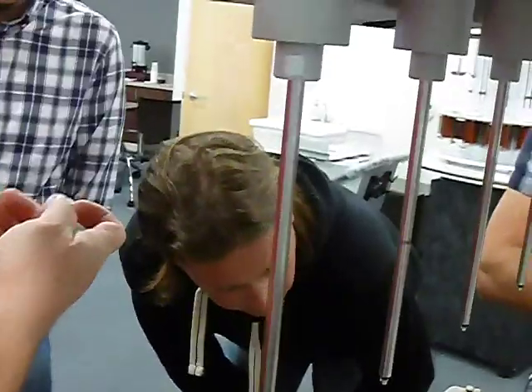These O-rings sometimes need to be replaced. Something you might want to think about on these things. That helps it to stay in place.